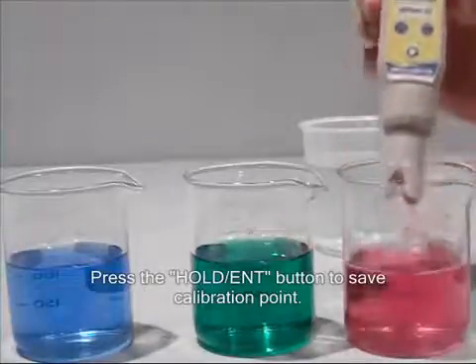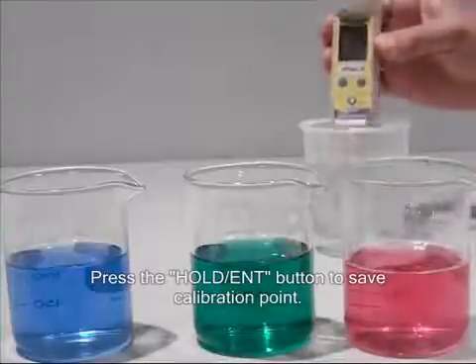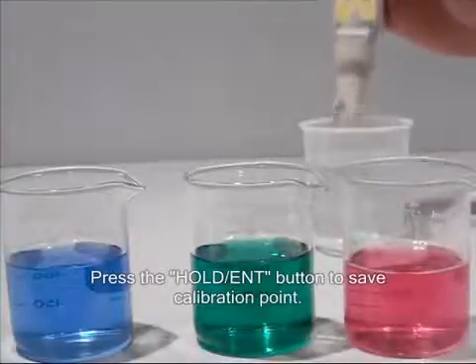Press the hold enter key, then rinse the electrode, and place in the final 10 calibration buffer solution.